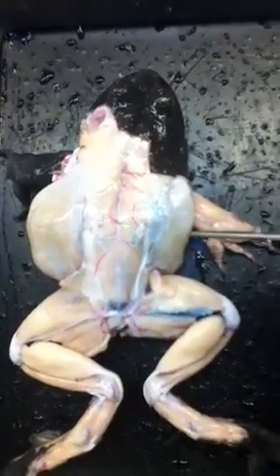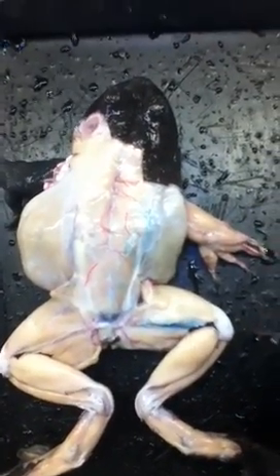There's only one other thing that we need to look at, and that's going to be on the dorsal side of the frog. This muscle right here is going to be the latissimus dorsi. And that is the mouth and the muscles — the parts of the mouth and the muscles that you need to know for the test and the quizzes.